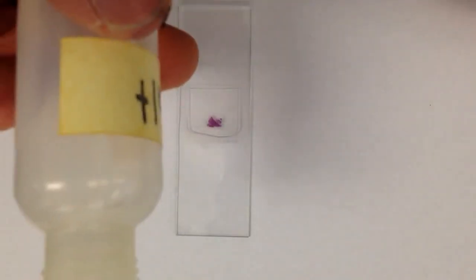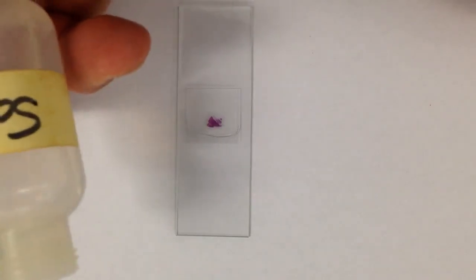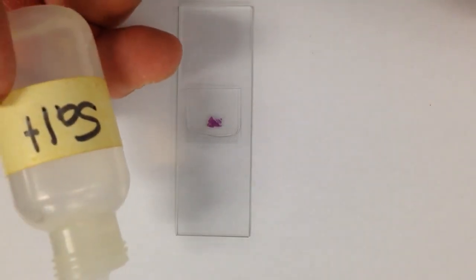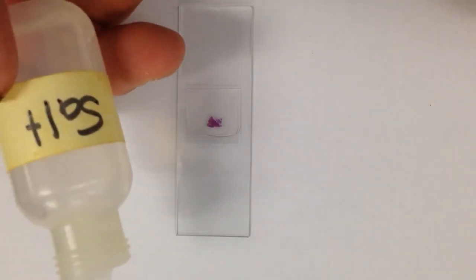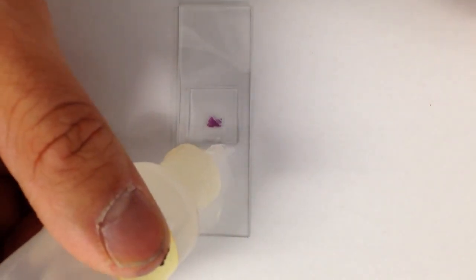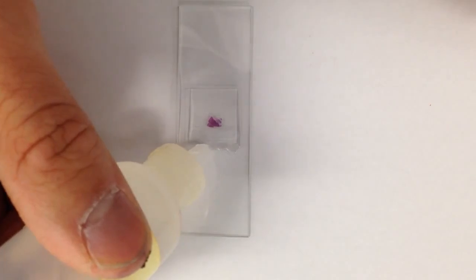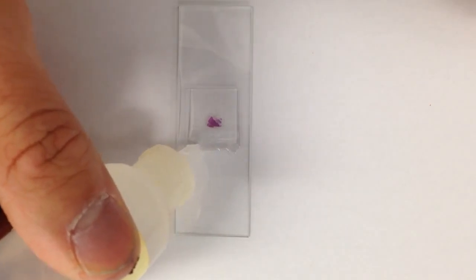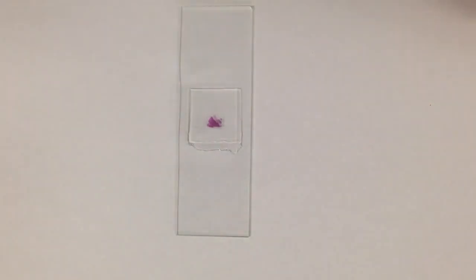To do that, you're not going to lift up the cover slip and dump salt water in it. We're just going to take our salt water bottle, and we're going to put some salt water on one edge of the slide, maybe a few drops, a few small drops.